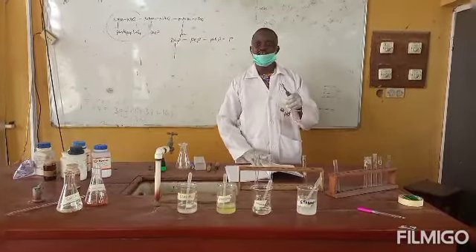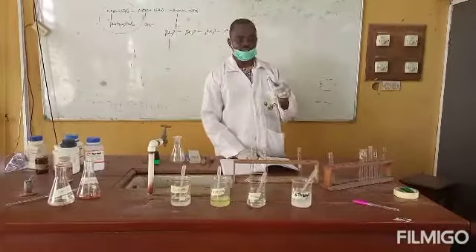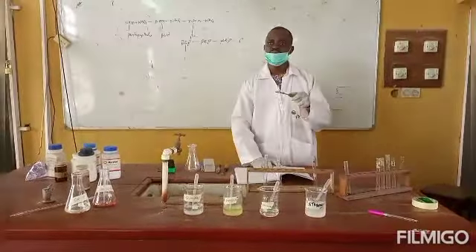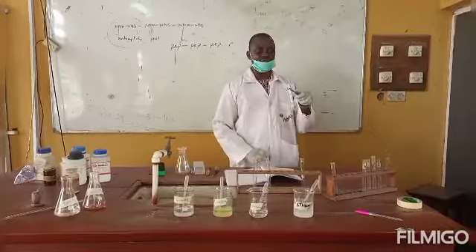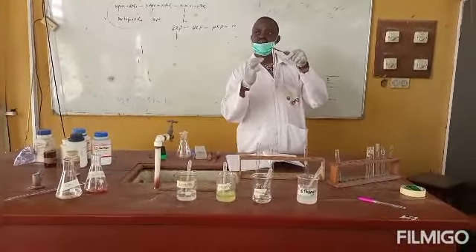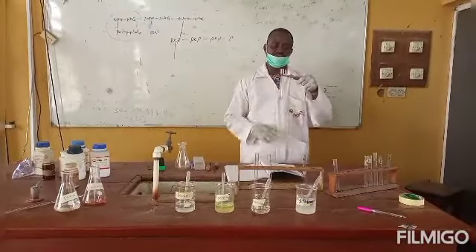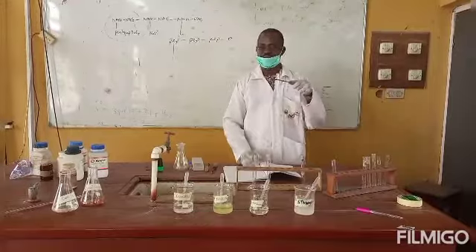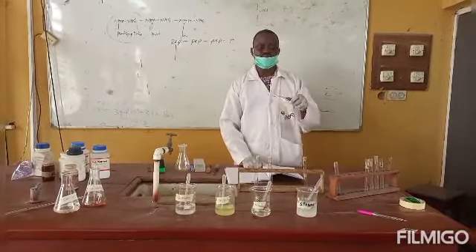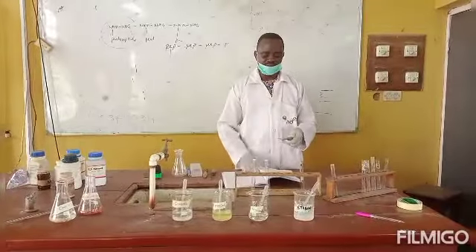The most feasible reaction is that immediately the conc H2SO4 gets in contact with the test solution, furfural will be formed, and then you will see a ring layer or a brownish ring separating 2 layers, one at the top, one at the bottom. When such a reaction occurs, it shows that the compound contains carbohydrates.